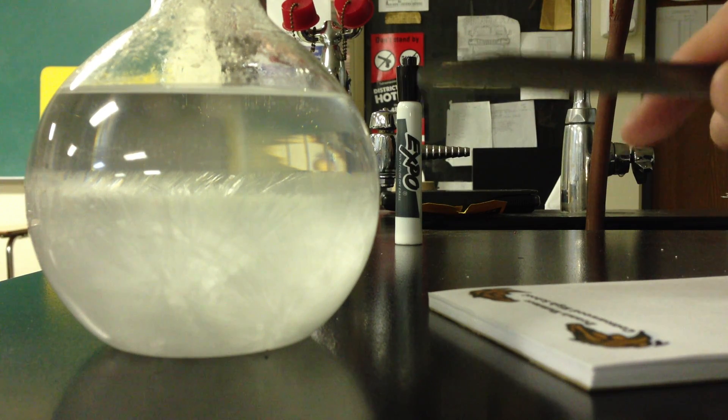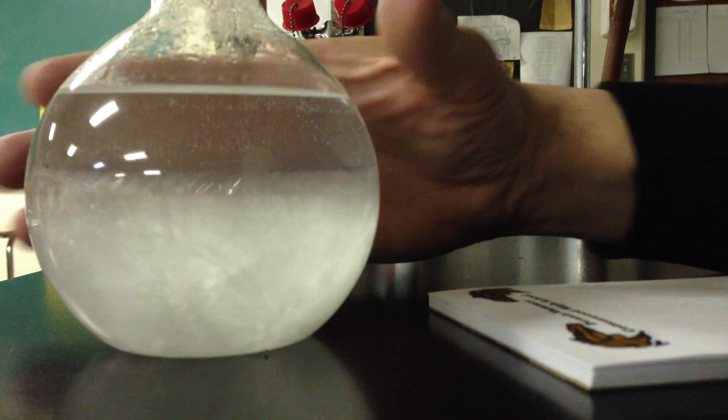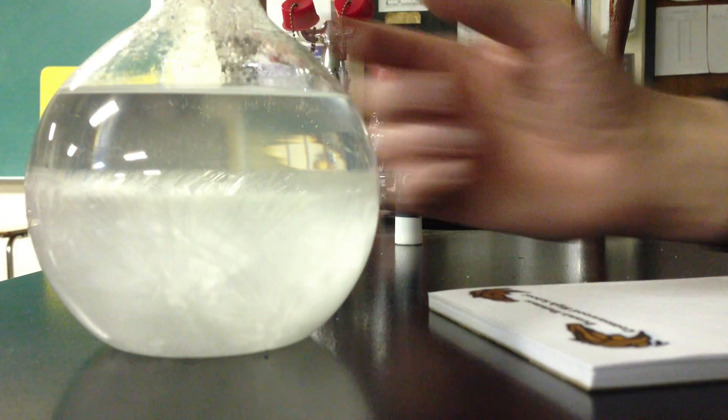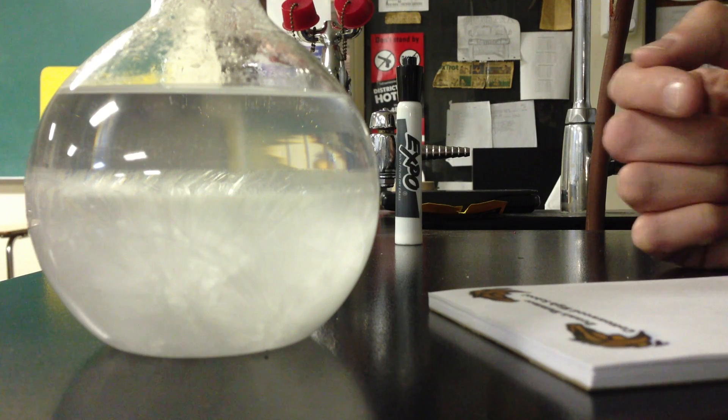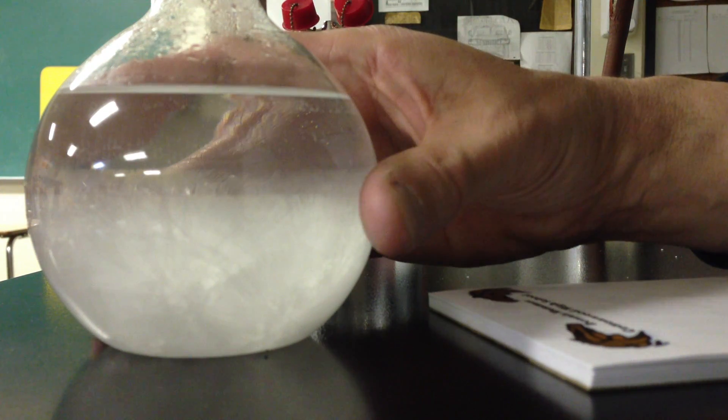Now, it took heat to get this all to dissolve. So what do you think it feels like right now, now that it's actually gone back in the other direction? It takes heat to get it to dissolve. When it comes out of solution, it's going to give off heat, isn't it? Or won't it?